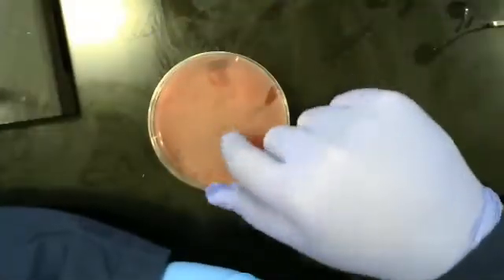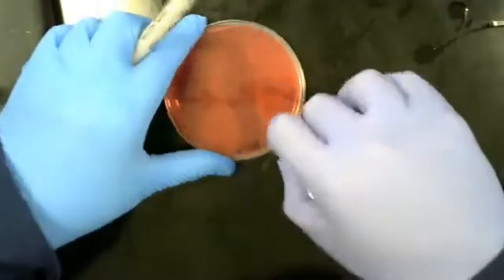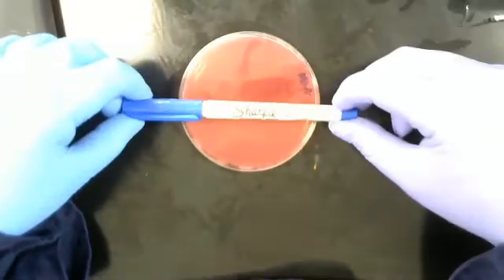Labeling for plates is done on the bottom of the petri dish, we'll flip it upside down, along the edge here. I personally like to use fine-tipped Sharpies, so we're going to be using this.